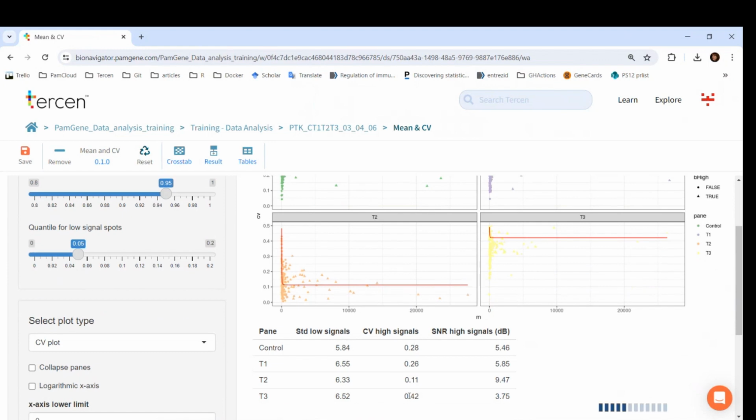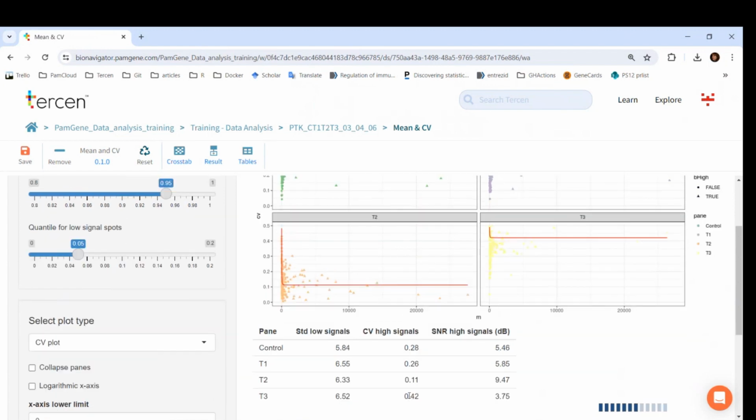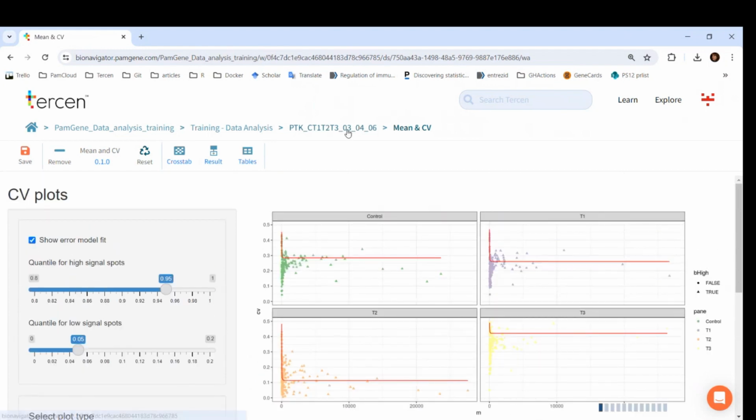adjust it when you have an NA for the CV high signals in one of the conditions. That means that the model could not be fit on the data, but adjusting these parameters within the given range is accepted and can solve this problem. However, when the model can't be fitted initially, the CV would be anyway very high. We suggest that in your reports, make a note of the quality metrics of your experiment and record these CV values.